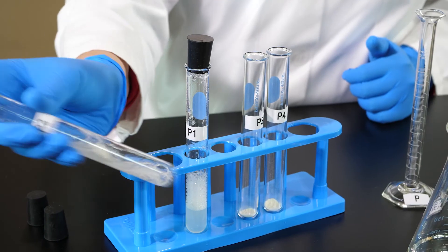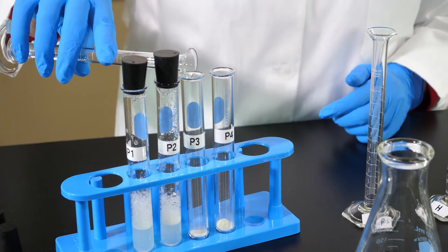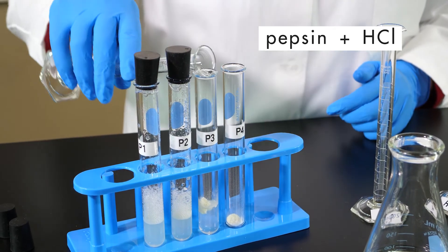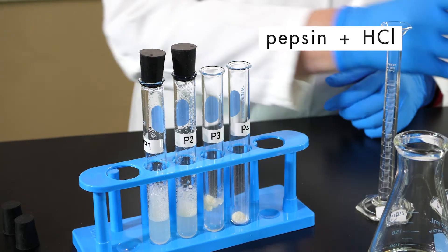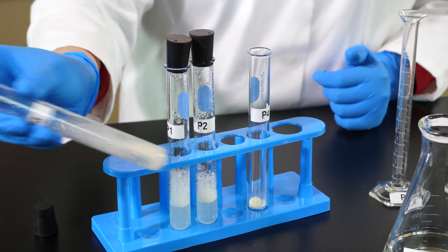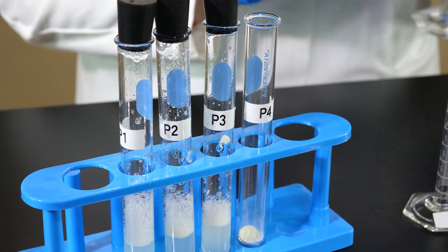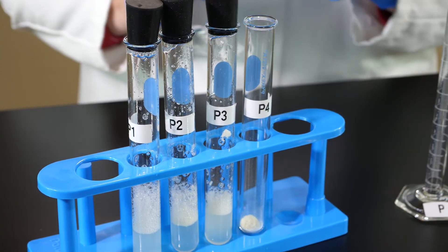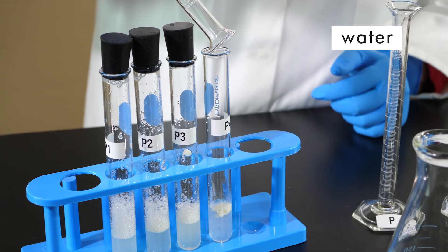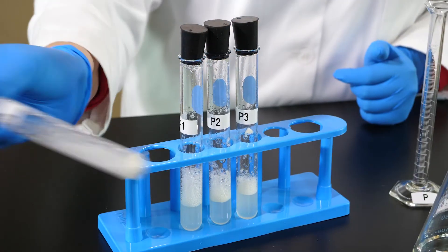We add 5 ml of hydrochloric acid to the albumin in test tube P2, and then mix the contents. We add 5 ml of the pepsin hydrochloric acid mixture to the albumin in test tube P3, and mix the contents. The fourth test tube is our control, so we add 5 ml of water to the albumin in test tube P4, and mix the contents.